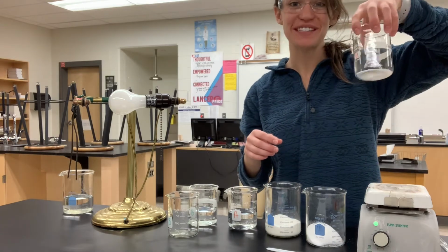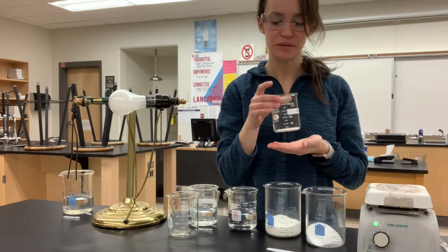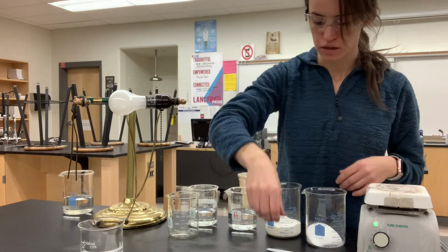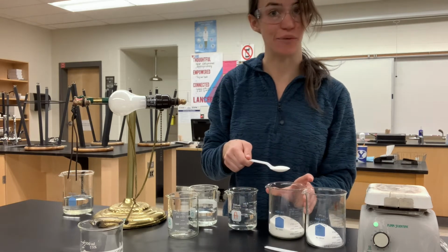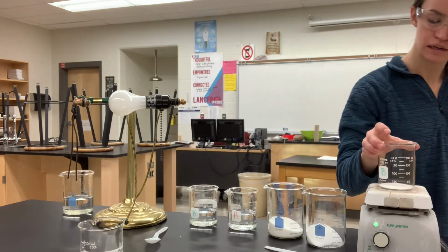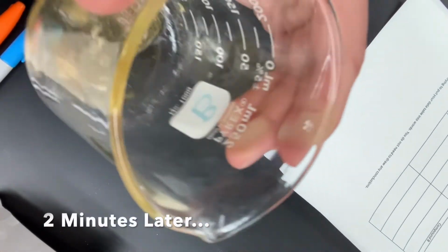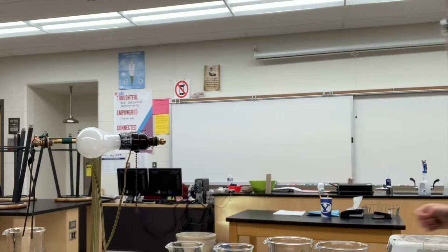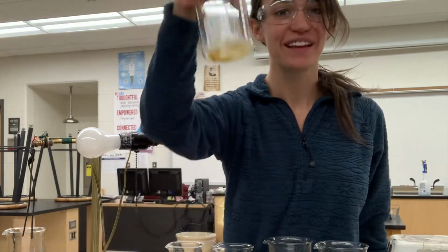All right, so we did it with substance A. Make sure you record the observations at the 5 minute mark, the picture that shows. We're gonna set this to the side now, and we're gonna try it with substance B. I'm gonna take 1 spoonful and put it in our B, and then we're gonna do the same thing and wait for 5 minutes and see if it's melting or not, right? All right, hopefully you're able to make some good observations for these, okay?